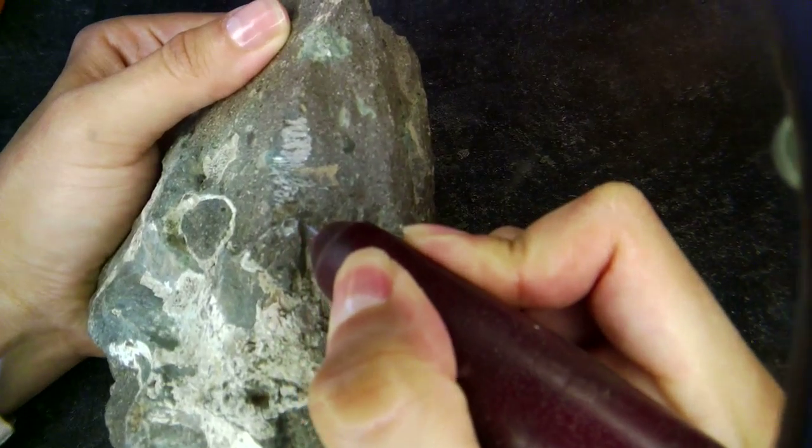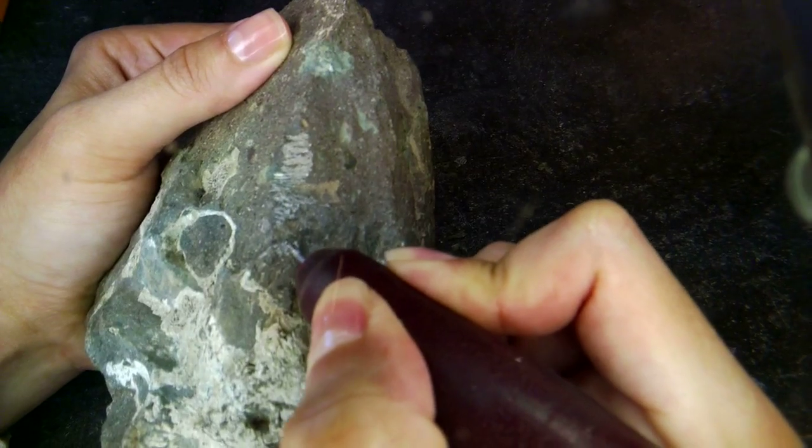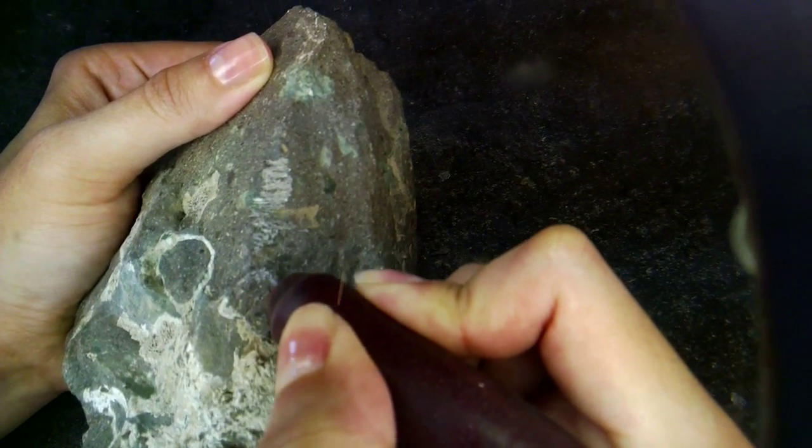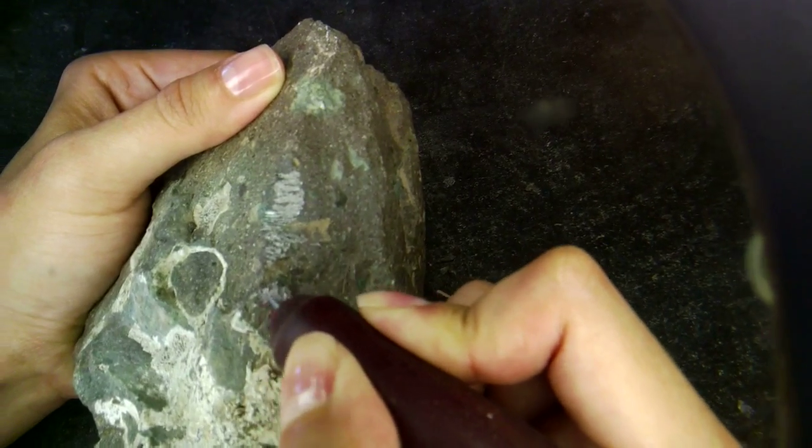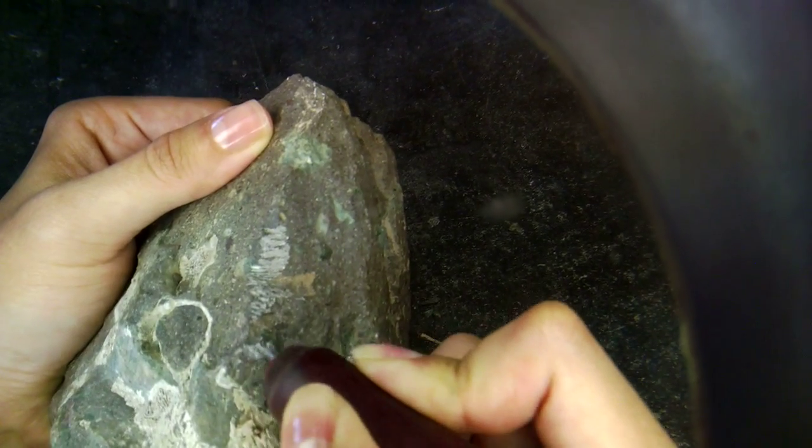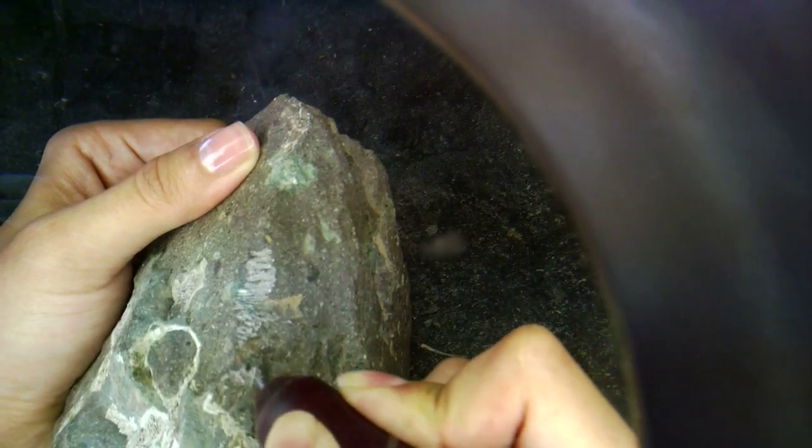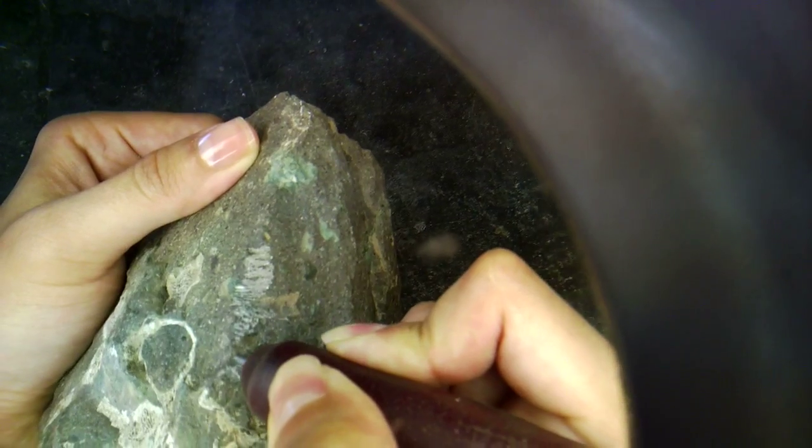I'm going to be putting the tool right next to the rock and try to chip it away very slowly. As you can imagine, I can do a lot of damage to the specimen if I'm not careful, so I'm going to be working pretty far away from the specimen itself and just trying to remove as much of this bulk rock that's surrounding it.